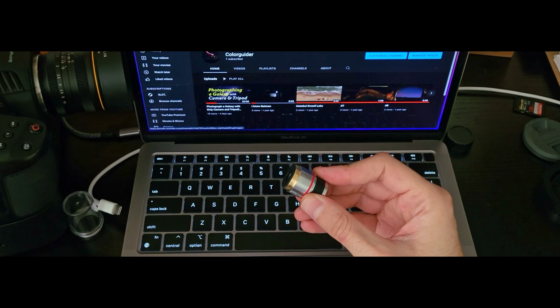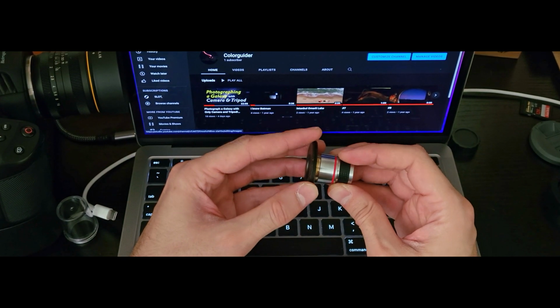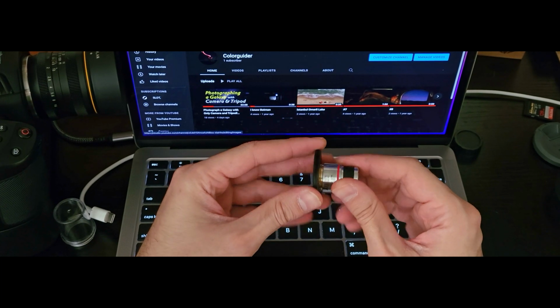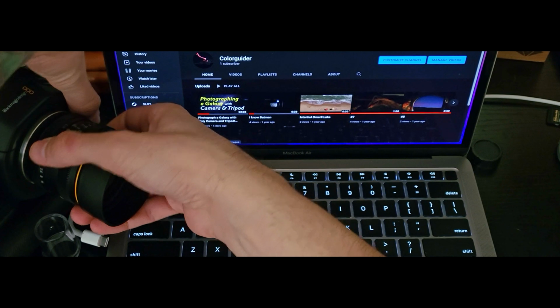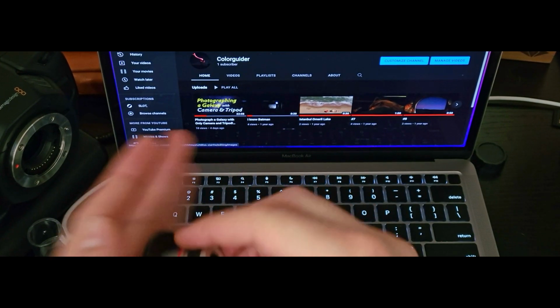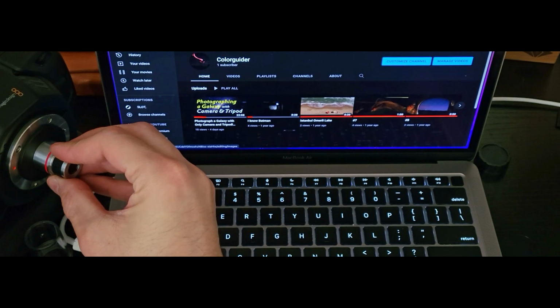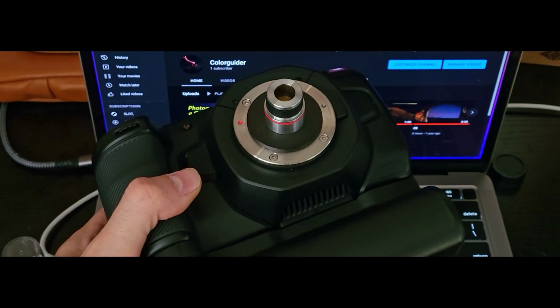Today I'm using the RMS to Micro Four Thirds mount adapter ring, and it was only $10 on eBay. Installing was also pretty straightforward, as you can see here. Now you can call this camera the Blackmagic Macro Cinema Camera.